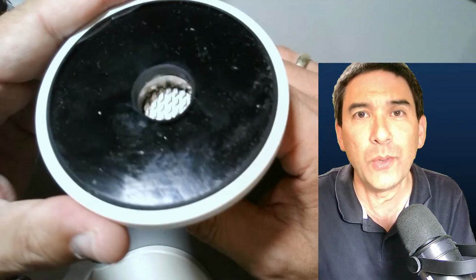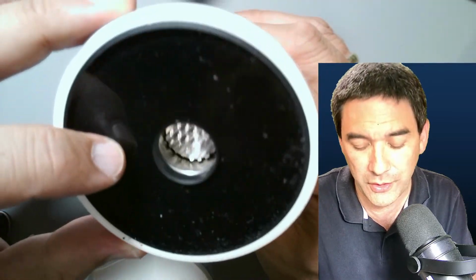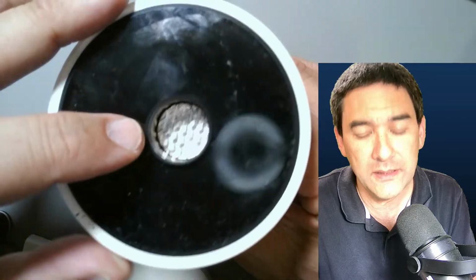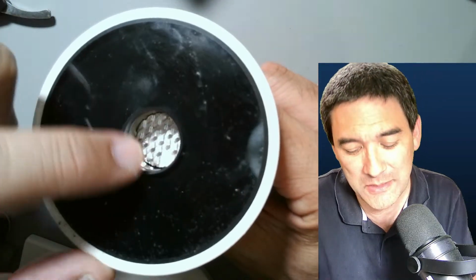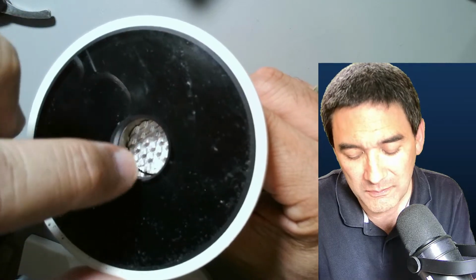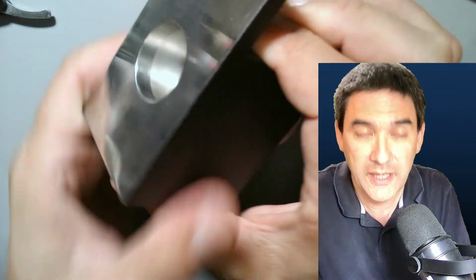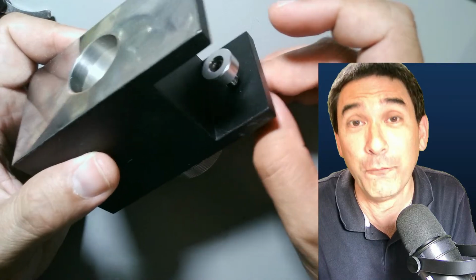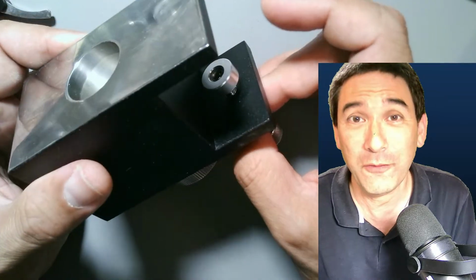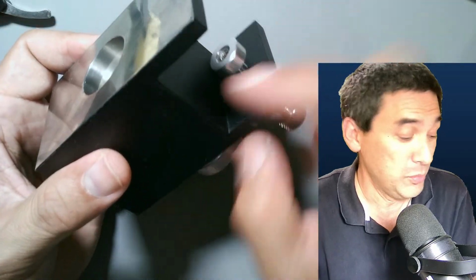I've also been using this one, and I've also made videos before, so some of you might also know this one over here. I did find that, depending a lot on the size of the specimens, the diameter was a little bit small. And then I quite accidentally discovered this one over here, and it was fairly affordable. It was only around 40 UK pounds, which is really, the others were more expensive.